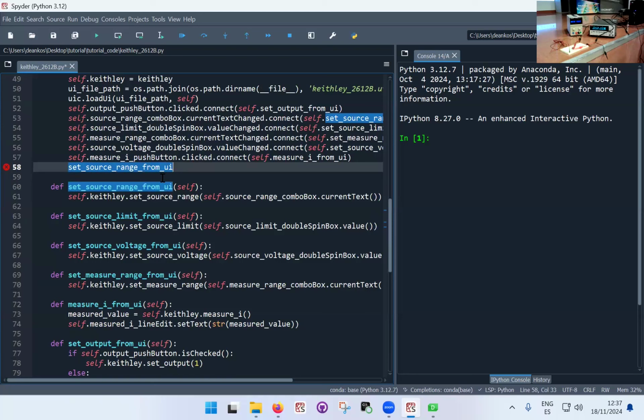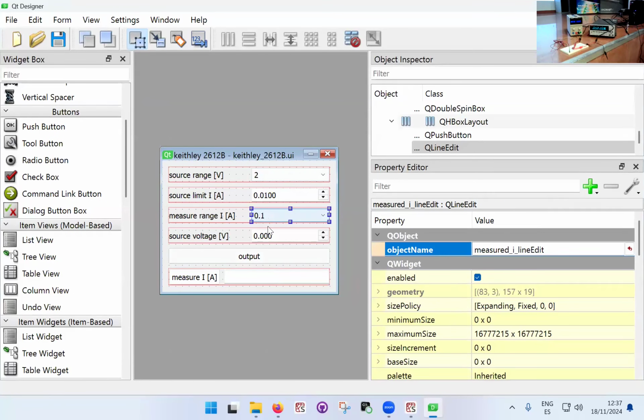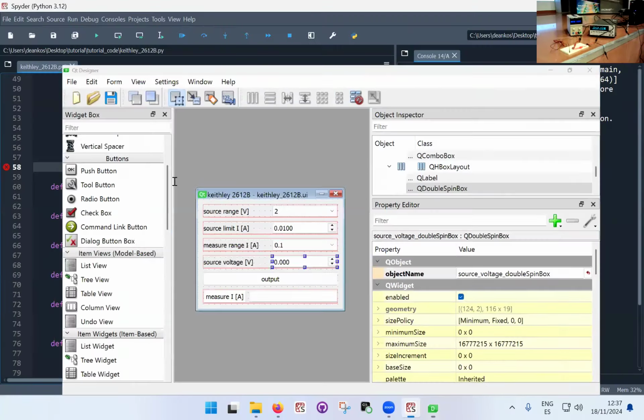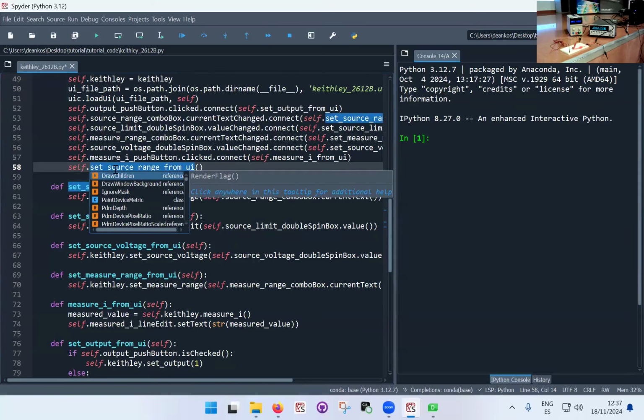And that's why you can use the user interface itself. So the numbers that you put here, yes, you can change them, but it makes sense to put something useful as a default value, because it saves you from then changing everything in the settings. So that's quite useful. So what I would do is execute each one of these functions, because I might shut down the experiment. The Keithley is left in a certain state, and then I reinitialize the same experiment, and I want the Keithley to go back to the settings, because maybe there's a specific setting that is important.